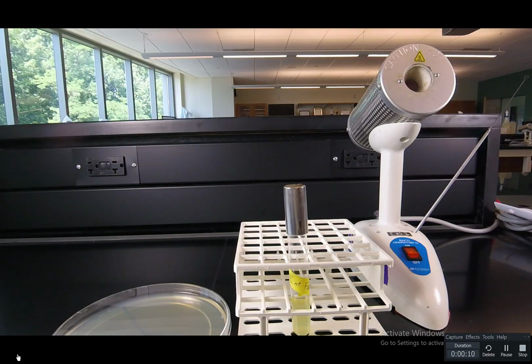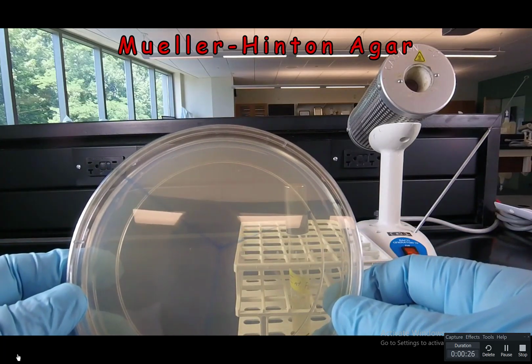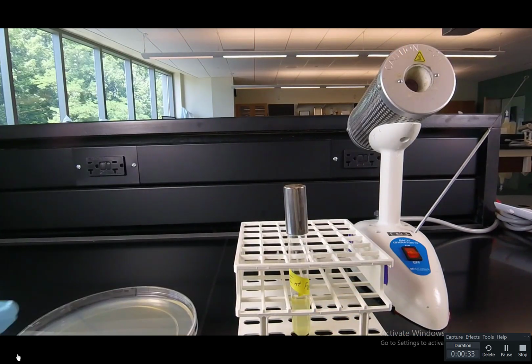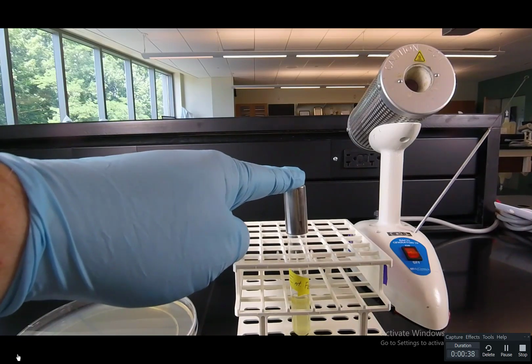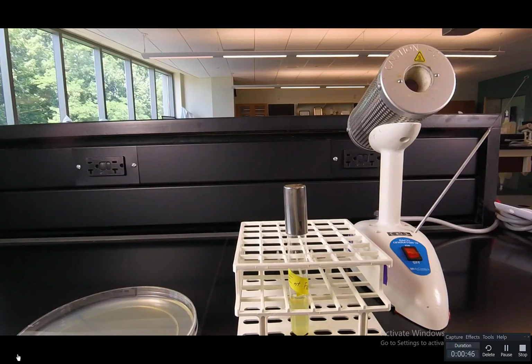In this video lesson, we're going to learn how to do the Bauer-Kirby method of antibiotic susceptibility testing. For that method, we use a standard size agar and plate called Mueller-Hinton agar, and these are the large 150 millimeter plates that will hold 12 different antibiotic discs. So the first thing we have to do is inoculate the Mueller-Hinton agar with the organism we're testing. Now in this case, this is one of the bacteria we're using in today's lab, Enterococcus faecalis. So we're going to be using a swab for this.